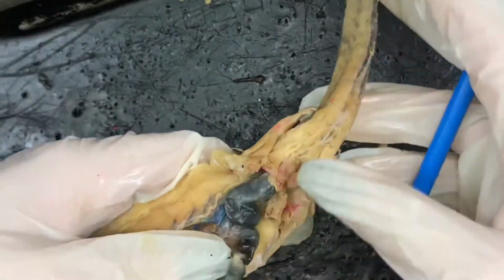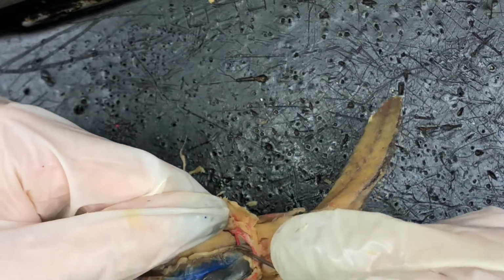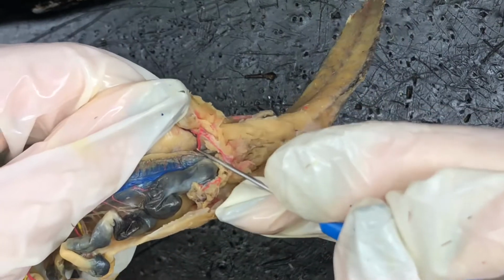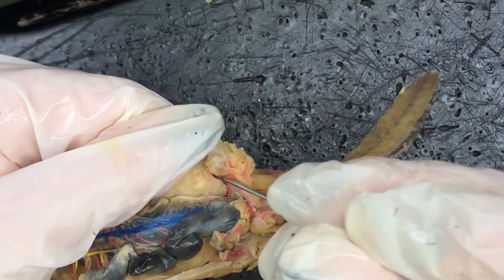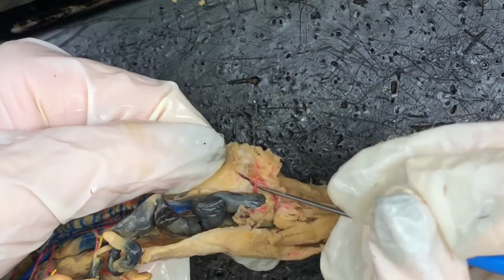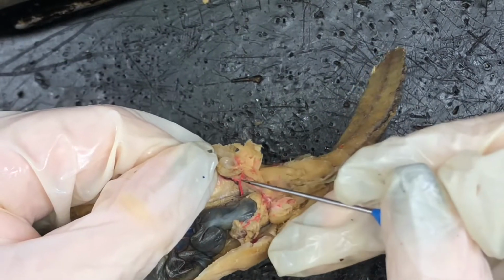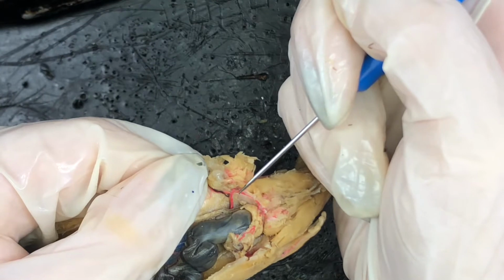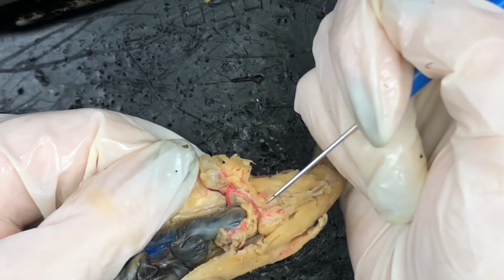And then we're going to move down into the leg. There's some arteries you need to know in the leg. Moving all the way down, we have this little branch right here. So here's the tail right here. This first little branch is the iliac artery. So we have the iliac artery. It's going to branch this way. As you can see, this is the epigastric artery. It branches towards the middle, right here, to the femoral artery. And then this one, this branch going this way, is the hypogastric artery. So we have the iliac, epigastric, femoral, hypogastric arteries.